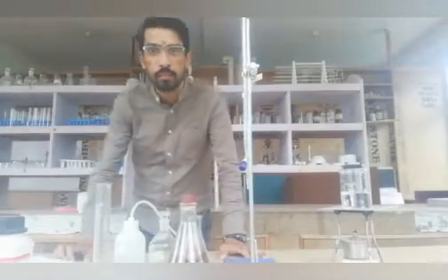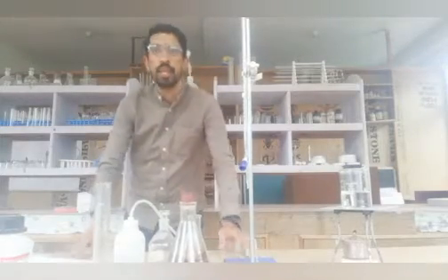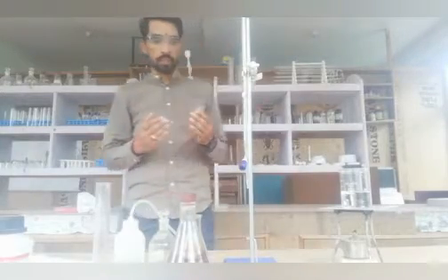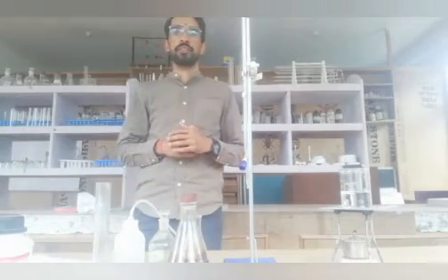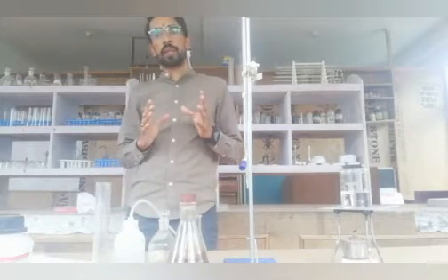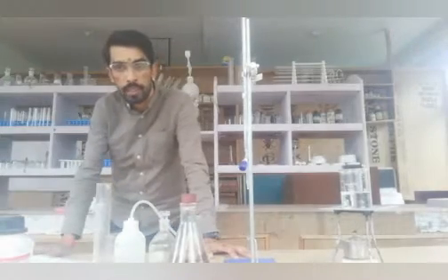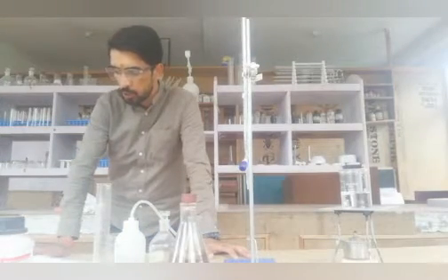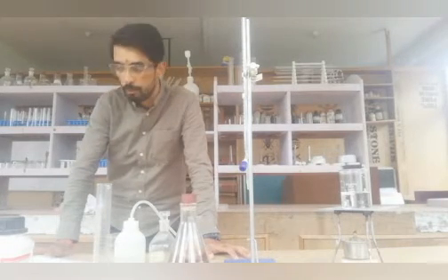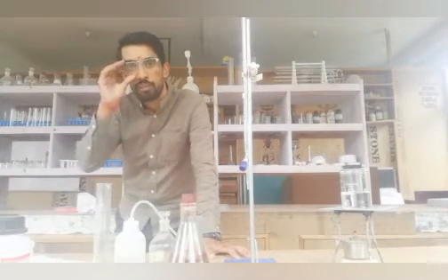Very good morning, dear students, welcome to this chemistry practical class. As in my previous video I told you about volumetric analysis practical, today I am going to perform that practical in front of you. The first step in any practical is we should know the experiment. The experiment name is: to prepare a standard solution of M/50 Ferrous Ammonium Sulphate, and using this solution to determine the molarity of the given KMnO4 solution.